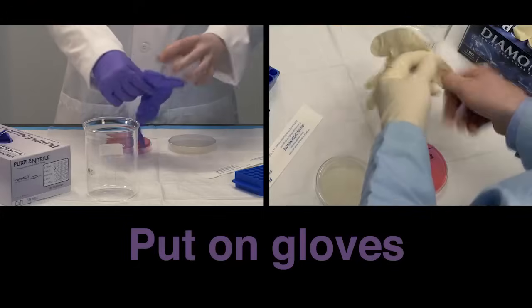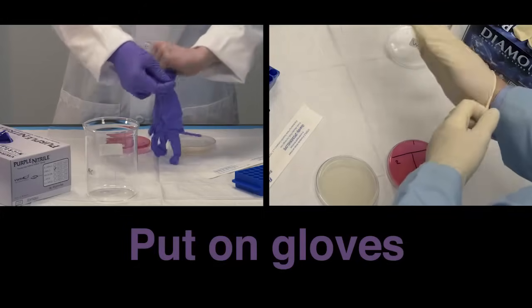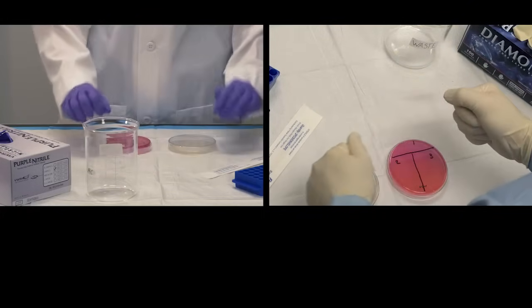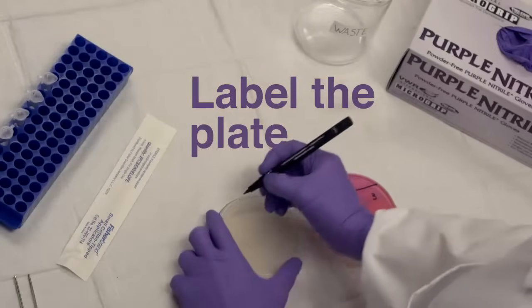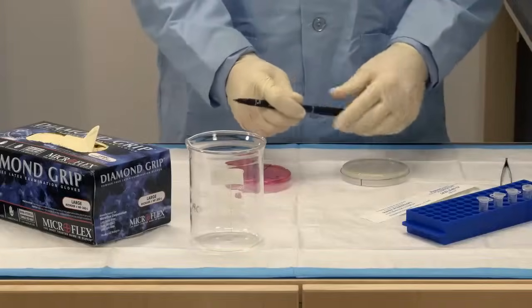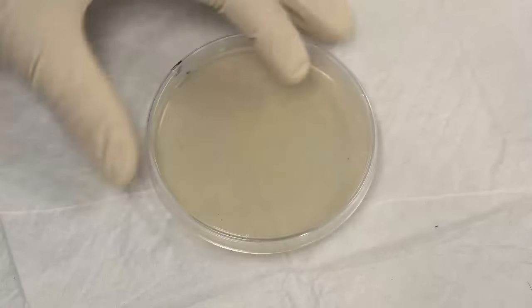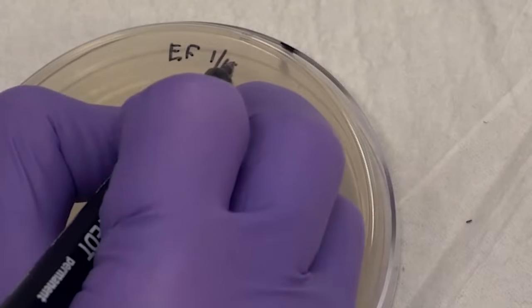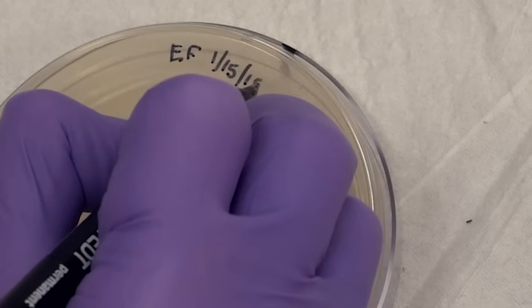First, put on the gloves, if they are provided. Next, label the bottom of the plates. You can write your initials, the date, and anything else your teacher would like.